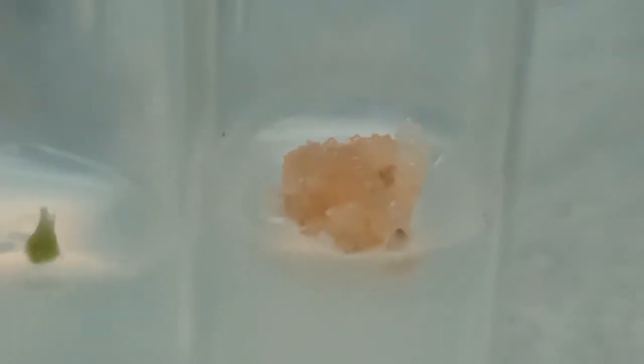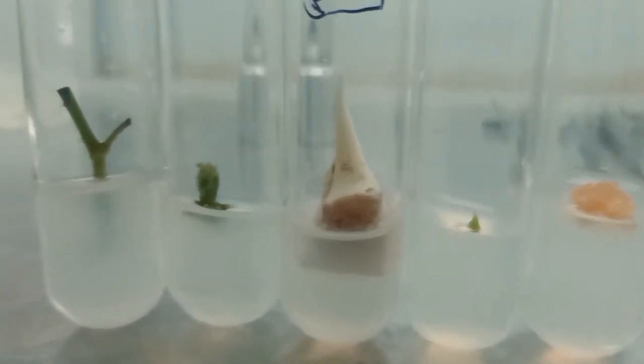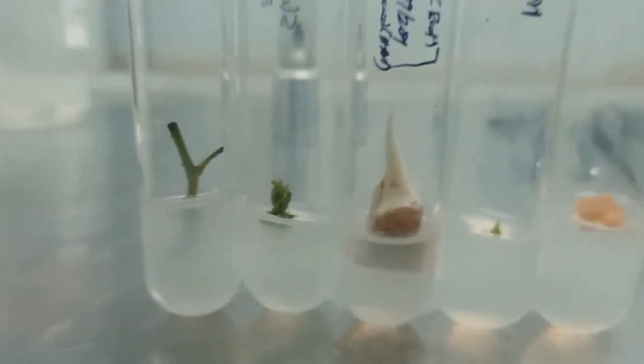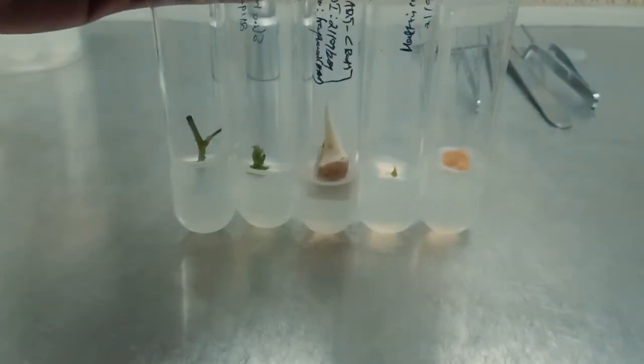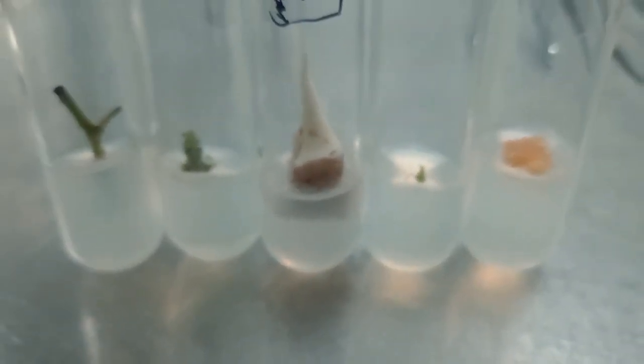Callus culture is induced with the help of 2,4-D, and the callus is used for secondary metabolite isolation. In direct organogenesis, direct plants emerge. In indirect organogenesis, callus and somatic embryos are produced. This video shows rose, cassava, banana, meristem tip culture of cassava, and callus culture.